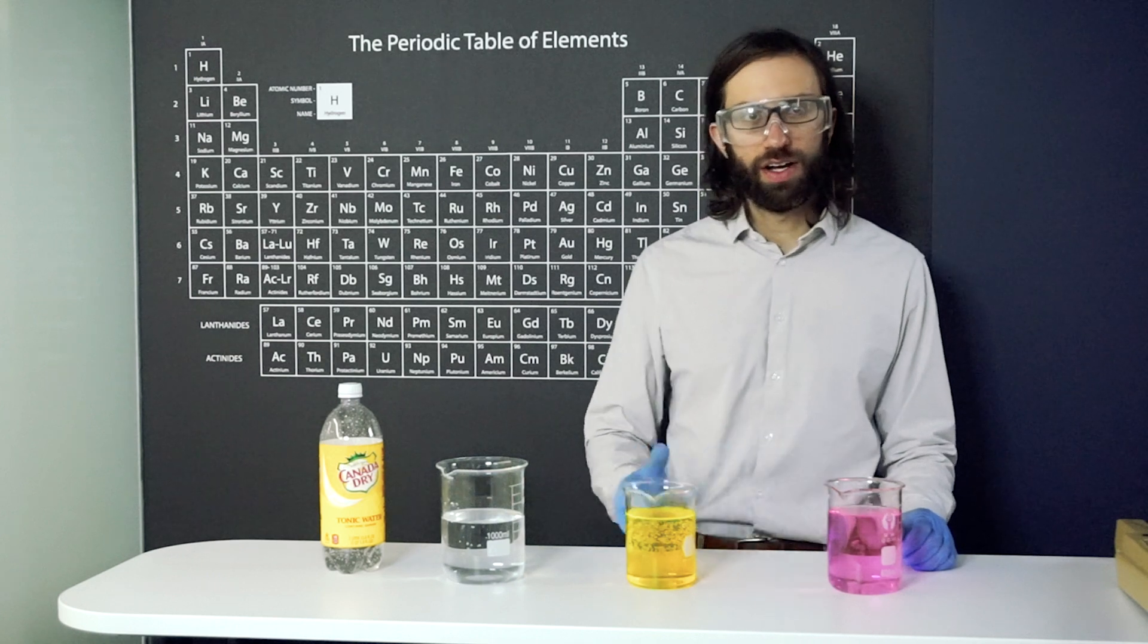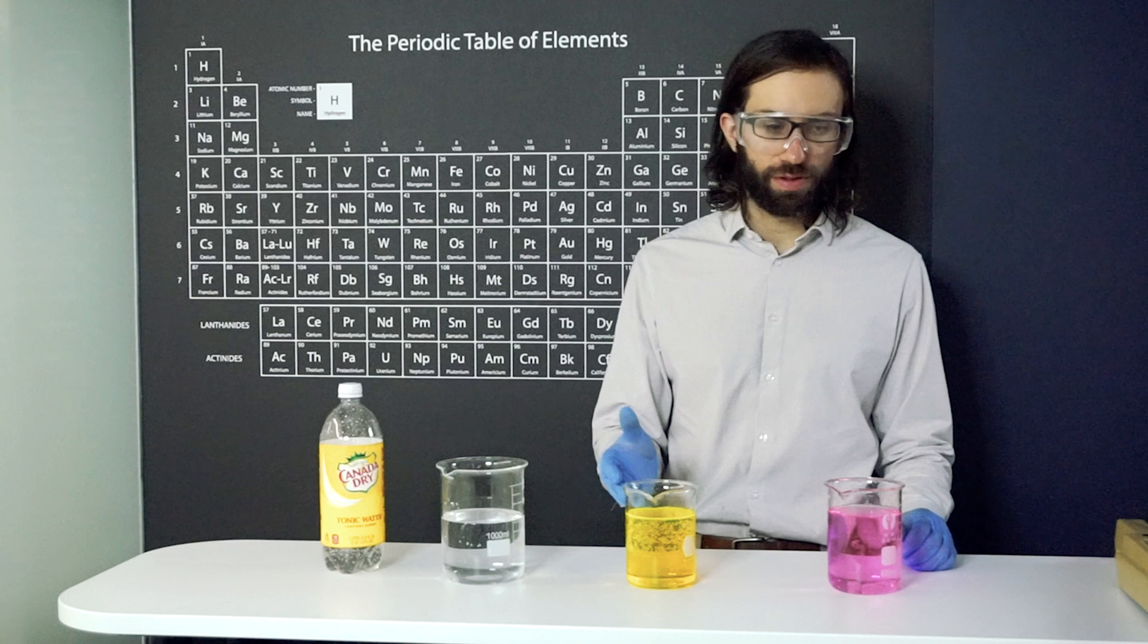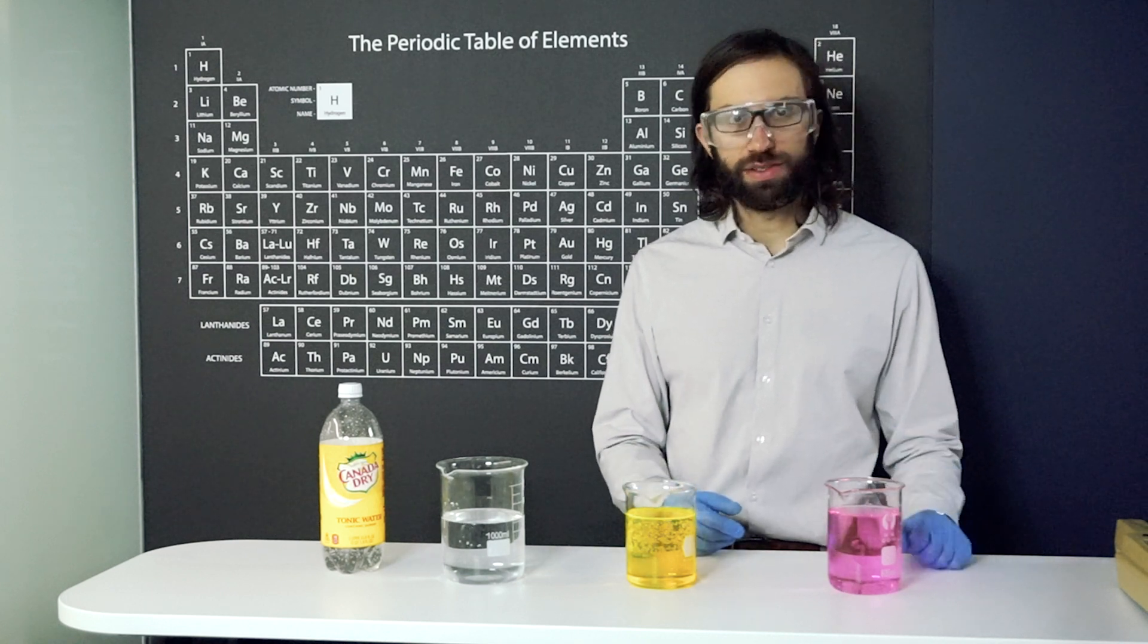And so you can see the colors that they are right now. We have a clear solution, quinine solution, yellow solution for fluorescein, and pink solution for rhodamine B.